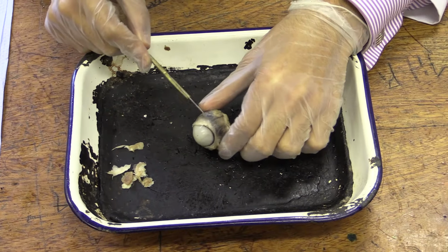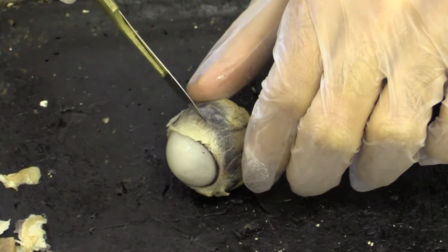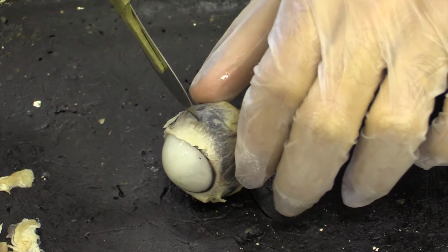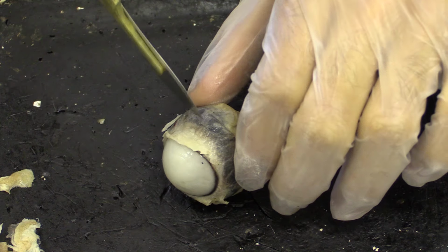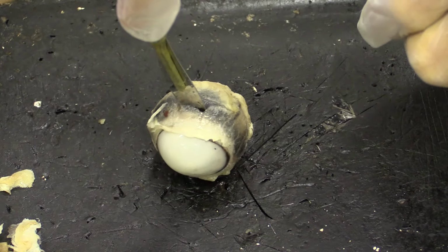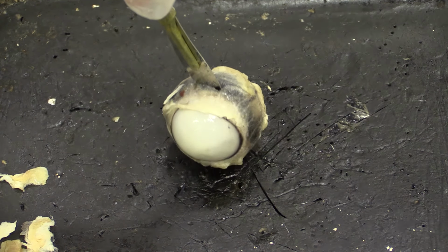And just posterior of the cornea here, this cloudy structure, just posterior, so we don't actually hit any internal structures, just posterior at the brown bit, we're going to make a cut. And that little splash was the internal liquid within the eye, which are known as humours. There's 2 types of humours.